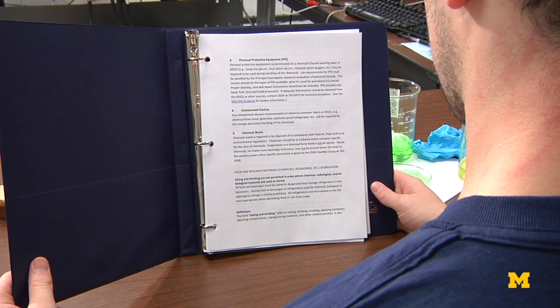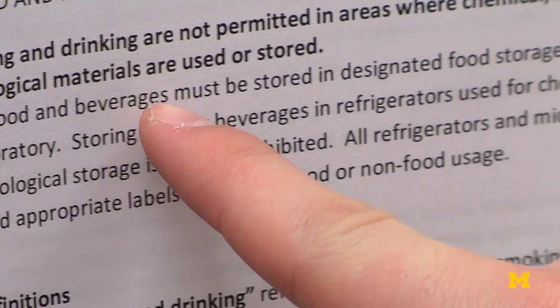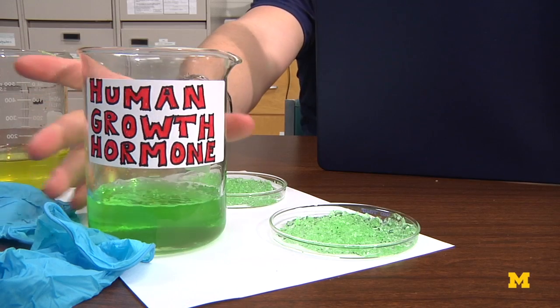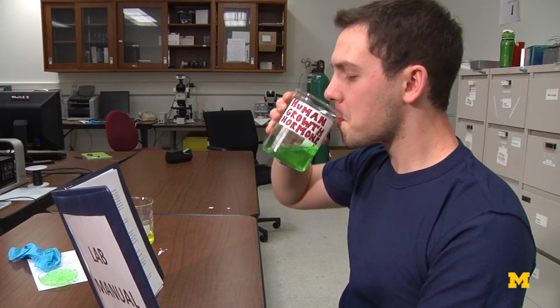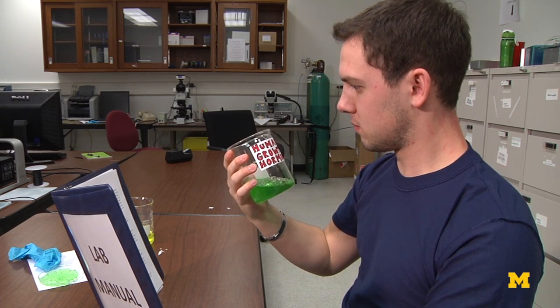Eating and drinking are not permitted in areas where chemical, radiological, and/or biological materials are used or stored. Oh, come on. All food and beverages must be stored in designated food storage refrigerators in the laboratory. What? The term eating and drinking refers to eating, drinking, smoking. Ah, dang it. Oops.